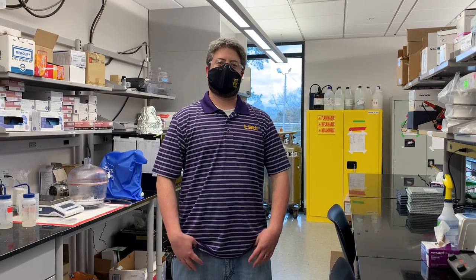Hello, I'm Dr. Adam Melvin. I'm an associate professor in the Cain Department of Chemical Engineering and today I'm going to give you a quick tour of the lab. My lab is very applied — we do a lot of tool development. We make novel bioanalytical tools to study several different biological systems, with the main focus being cancer, cancer metastasis, and cancer diagnostics.